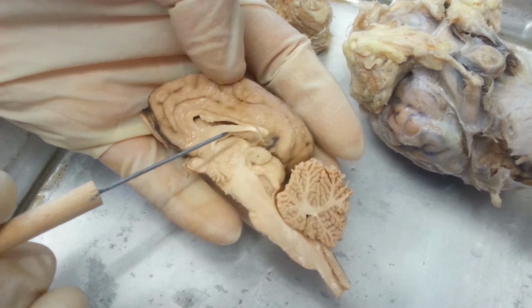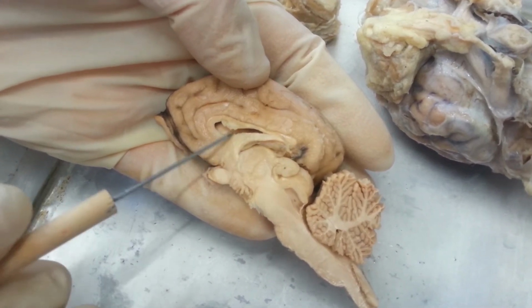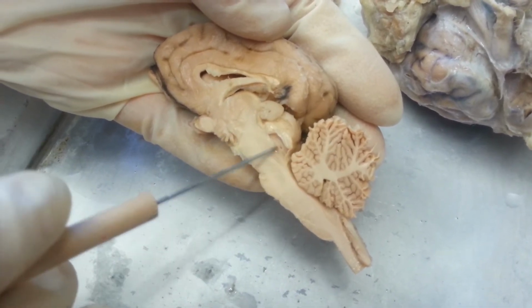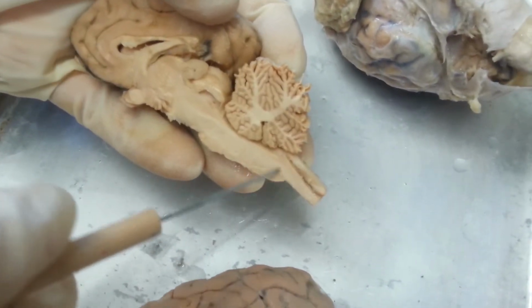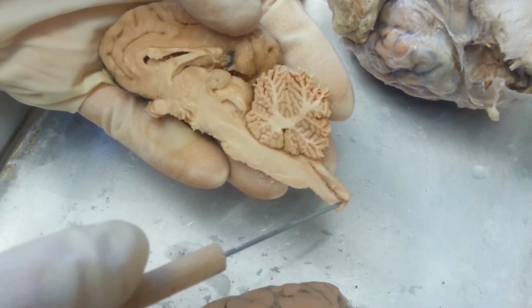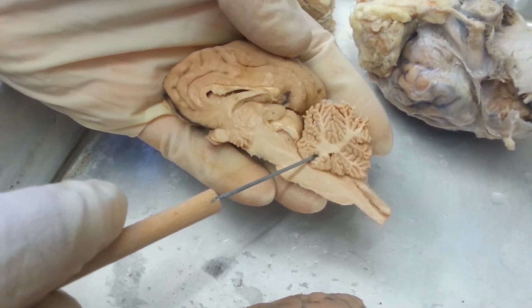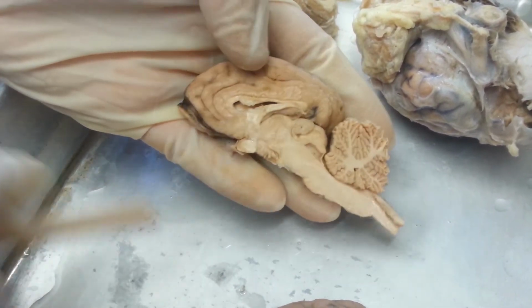Then you have spaces filled with fluid. I'm going to go through those. Within the septum pellucidum, which is separating them, are the two lateral ventricles here. Then you have the third ventricle here, and the cerebral aqueduct, which connects the third and fourth ventricle. Once you get to the spinal cord, after the medulla, this is the central canal. This structure here that looks like a tree is called the arbor vitae. It looks like branches. Let's see, what else am I missing? Yeah, that's all of them. So we covered all the structures you have to know.